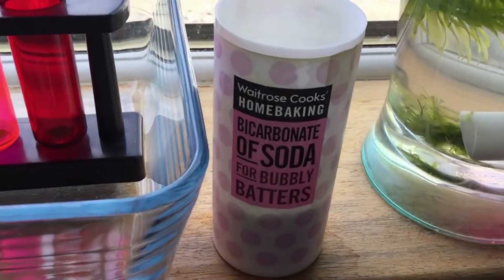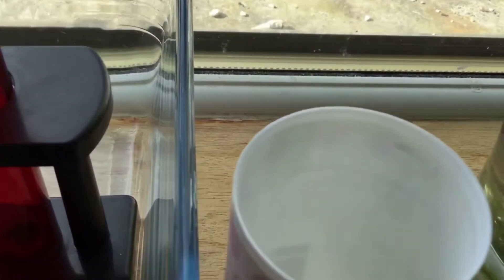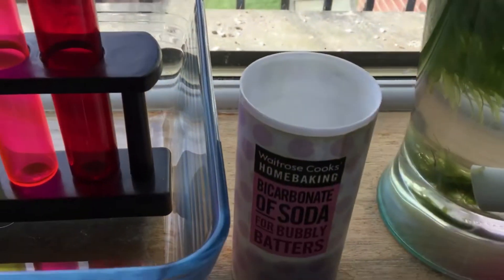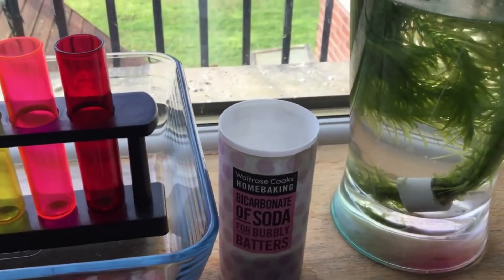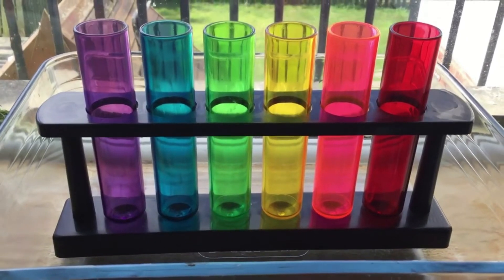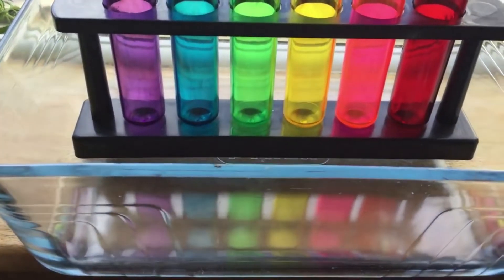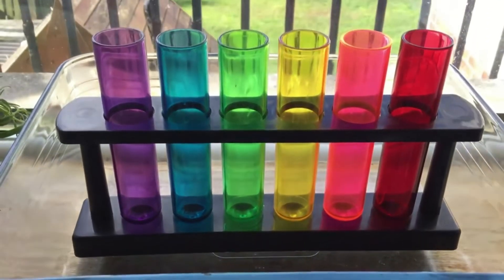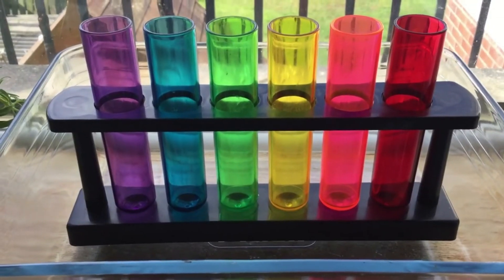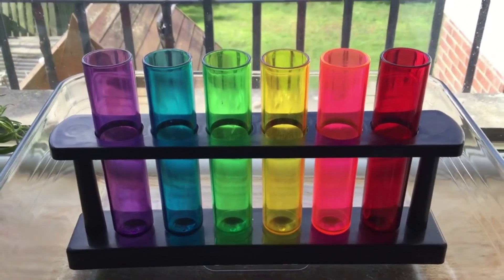I have some bicarbonate of soda, which is normally used in baking — it's a white powder. This will supply carbon dioxide when added to water. We have six colored test tubes in the colors of the rainbow. I'm going to add water to the dish and then add the bicarbonate of soda, then add equal sized pieces of pondweed and we'll see how the plant photosynthesizes in the sunlight.